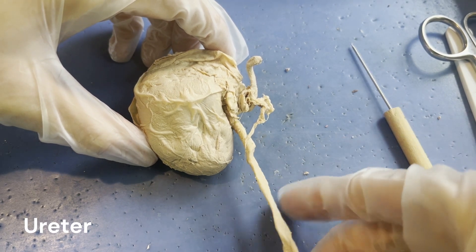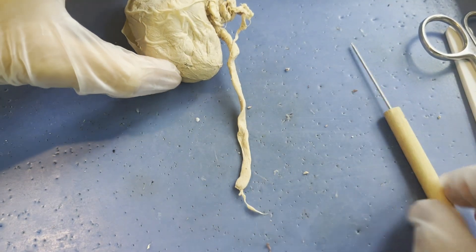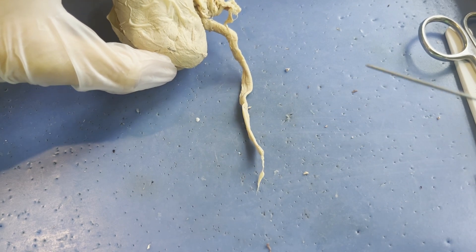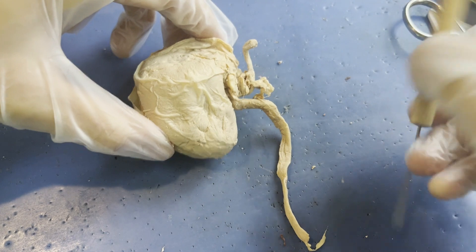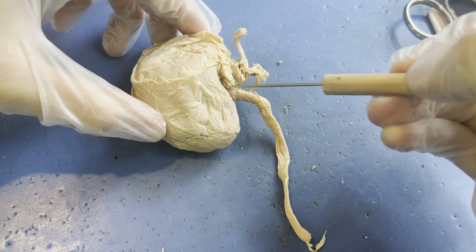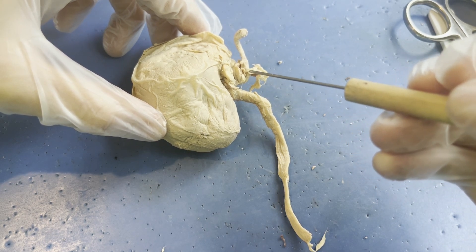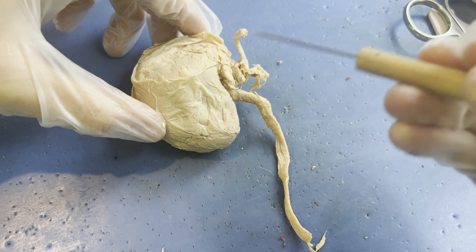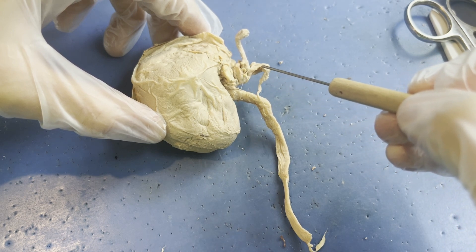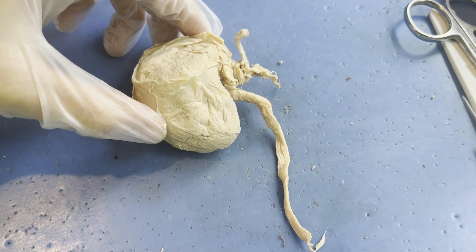Each kidney has a ureter — these thin tiny tubes that go down your lower back. And if we had the full urinary system of the sheep, at the end of this ureter we would find the urinary bladder, which stores urine until it's an appropriate time to urinate. Now remember, the dirty blood comes in the renal artery, the blood gets filtered and cleaned, and all the waste goes down the ureter. But what about the good blood left over — the red blood cells, white blood cells, platelets, water, and plasma? That stays as blood and travels back into your bloodstream through your renal vein, which takes away this filtered but now deoxygenated blood from the kidneys.